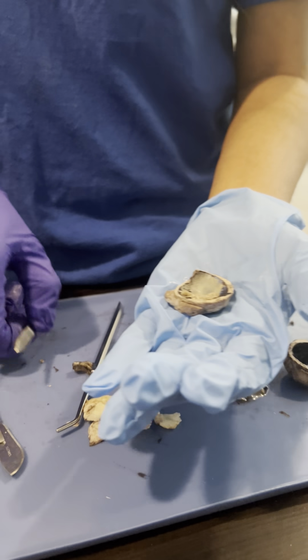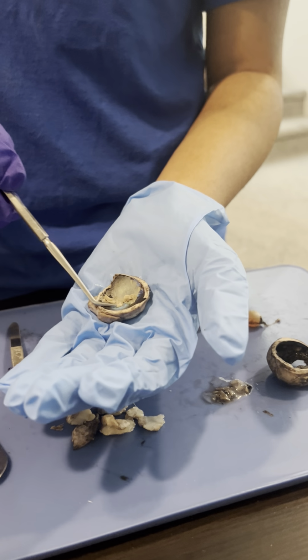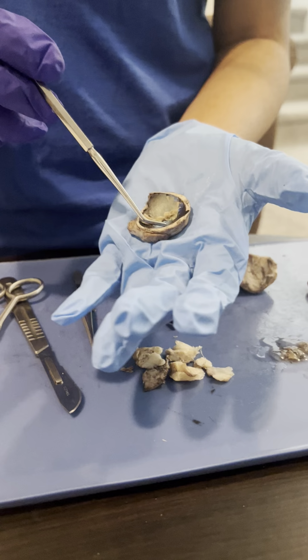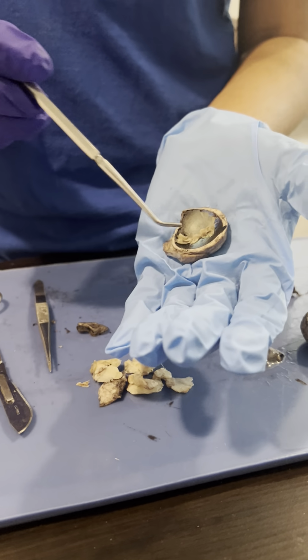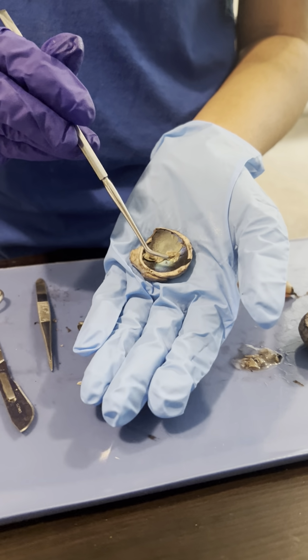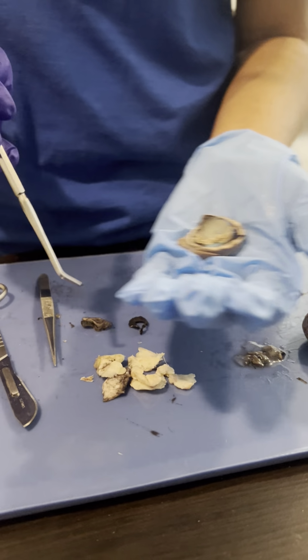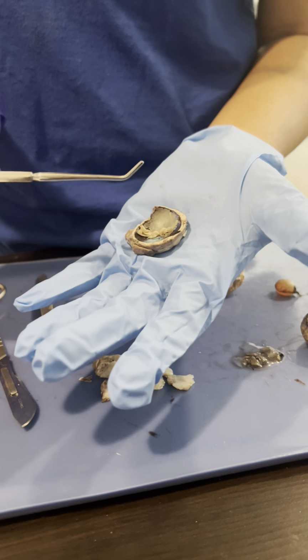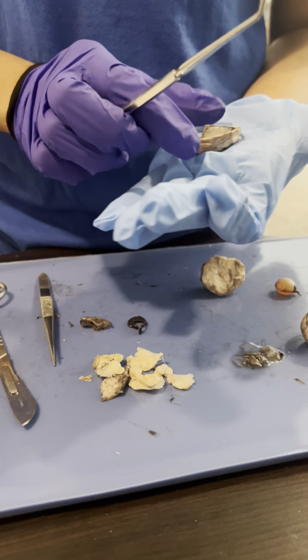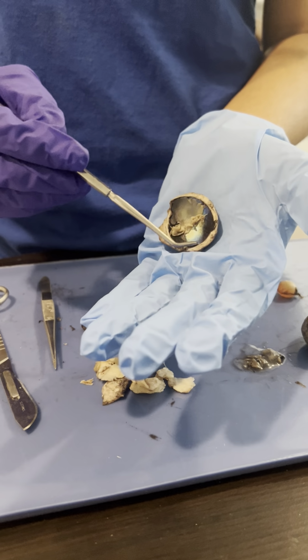Going back to the retina, behind it we have the choroid. This choroid is just a dark tissue between the retina and the sclera. And the bluish-greenish part over here is the tapetum lucidum, and it helps in night vision by reflecting light back onto the retina. We can also see the sclera over here.